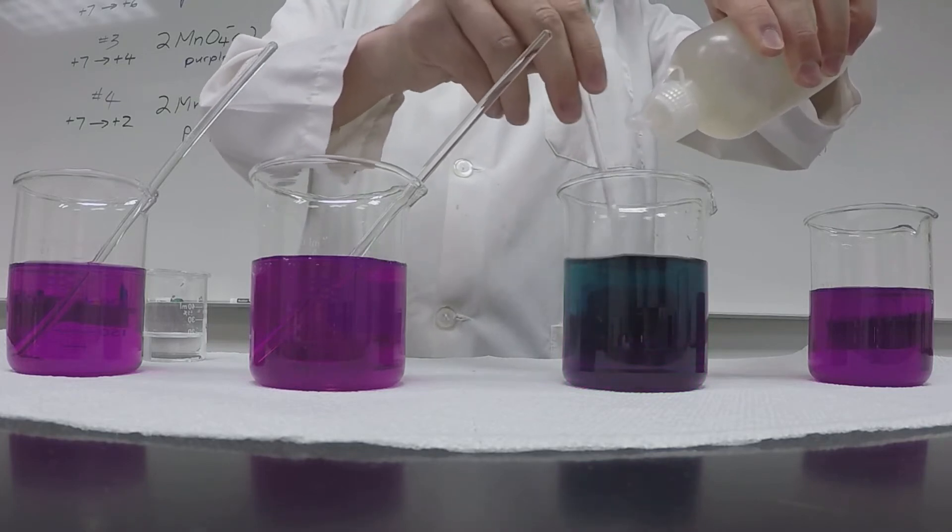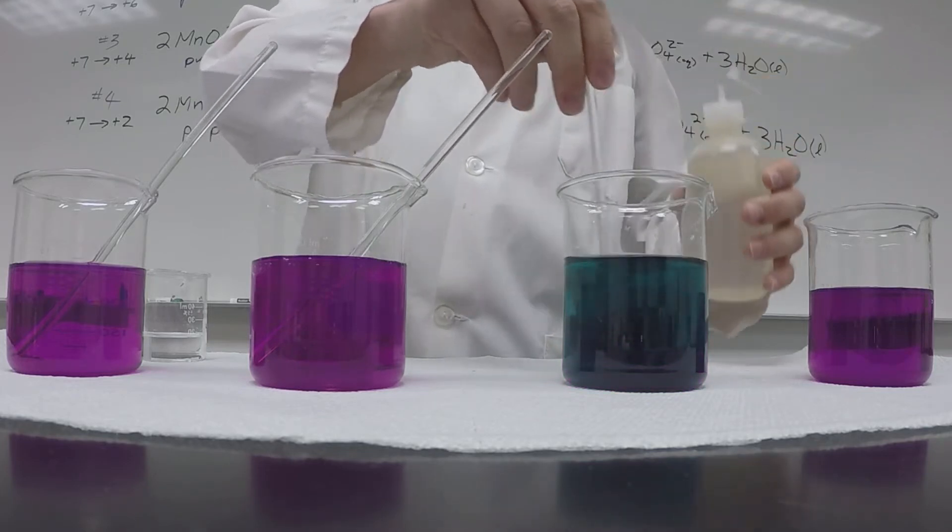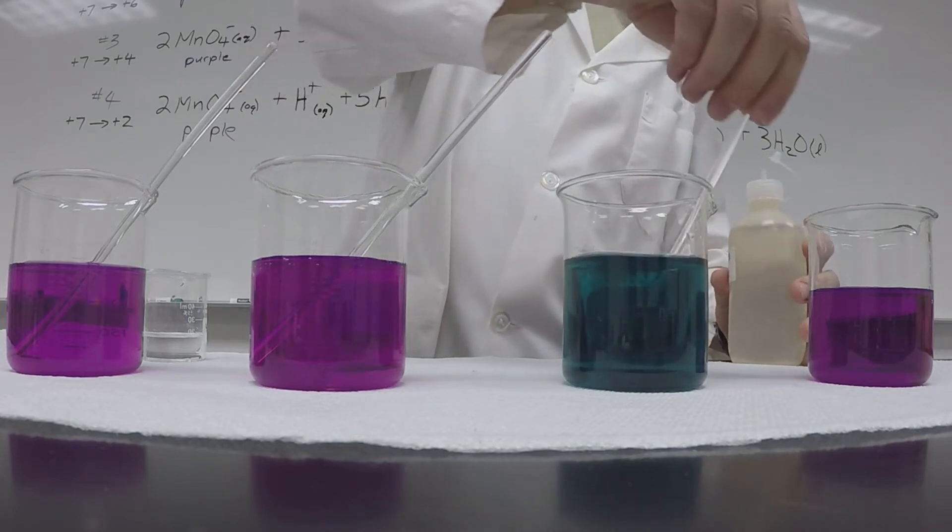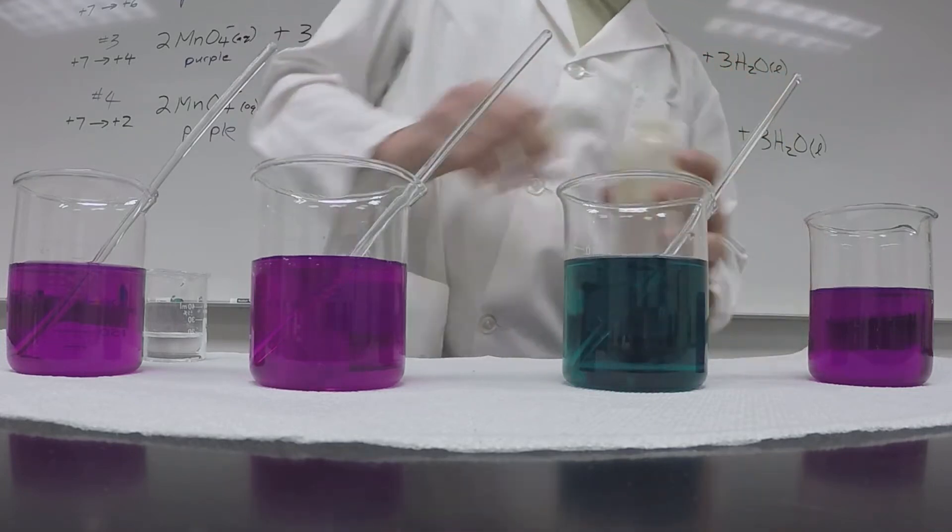You can already see it starting to change color, and there's that green color we're looking for. So that's the first one.